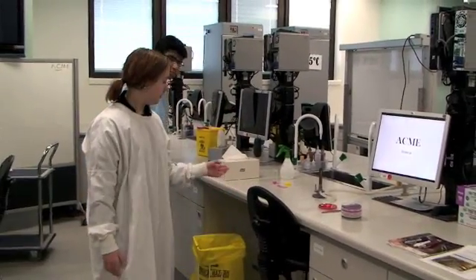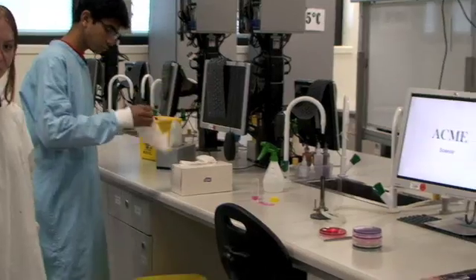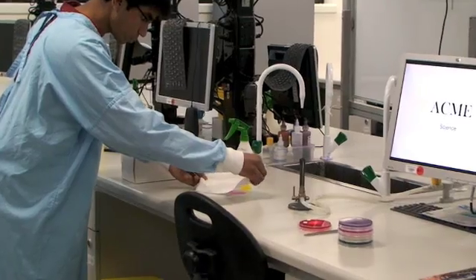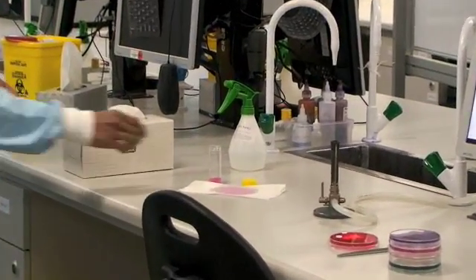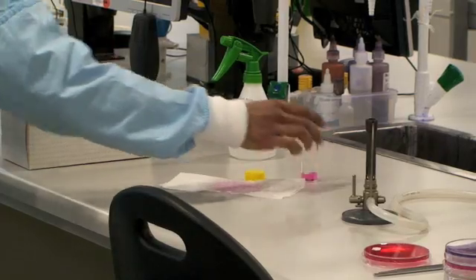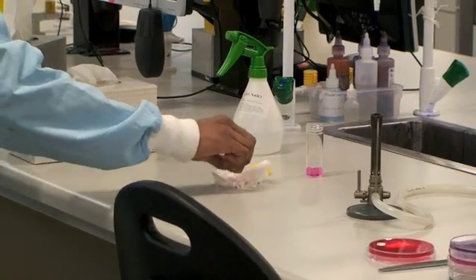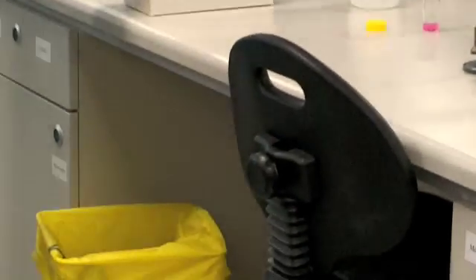You'll also notice on this bench that there has been a spill. If you spill something on the bench, soak up the bulk of the liquid and dispose of the tissues, and then spray the bench with sodium hypochlorite and wipe it down. All contaminated materials go into the yellow biohazard bin.